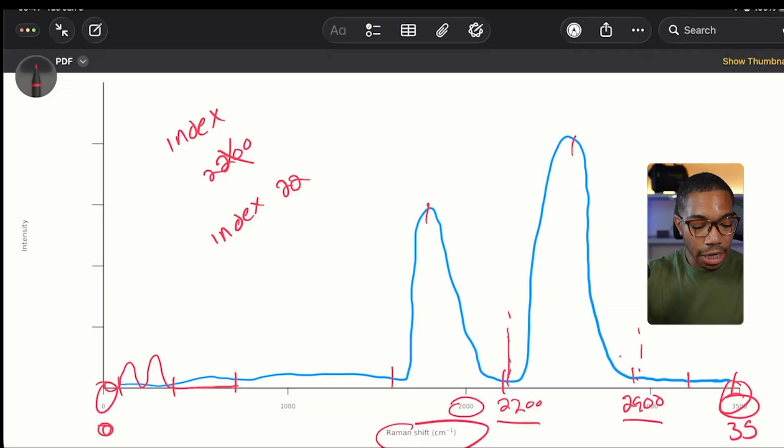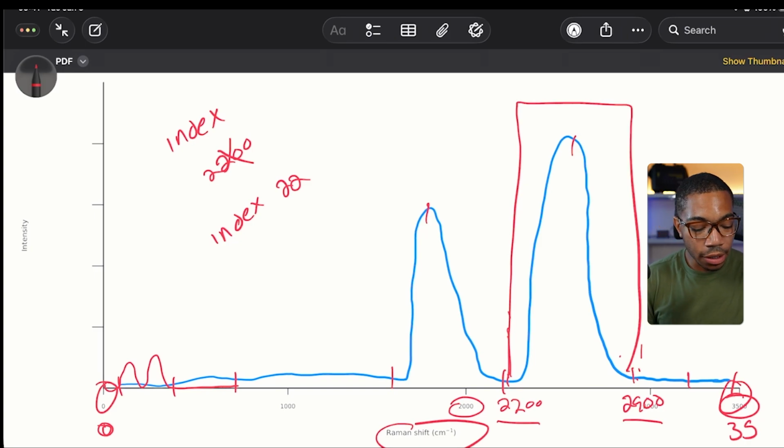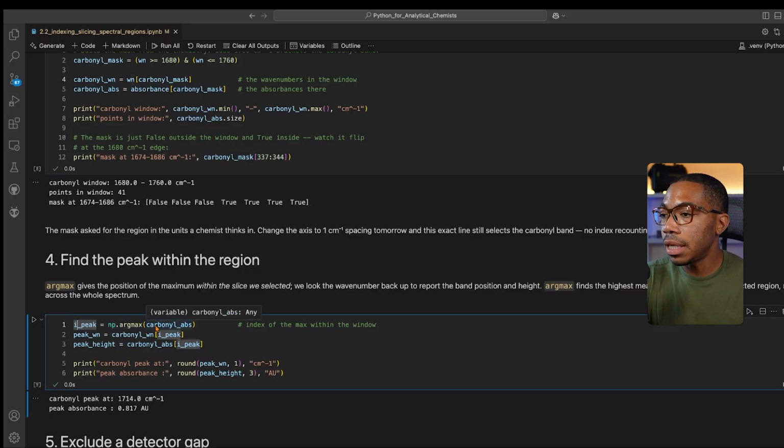So within a slice, we might want to identify the local maximum. For example, we slice here and we only care about what's in this region. We could then look for where the local maximum, or perhaps even the global maximum, occurs within this slice, so we can actually determine where the peak height is. To do that in Python, we can use the argmax method from NumPy, and this will give us the index of the maximum value within that region, and then we can apply the same filtering logic for iPeak.